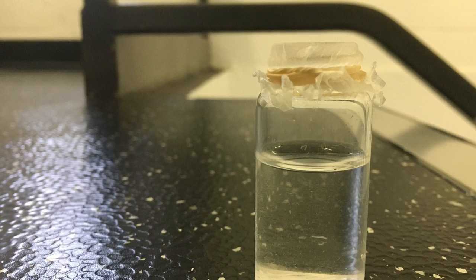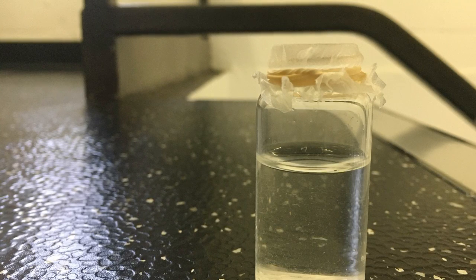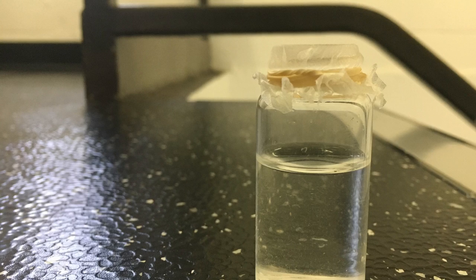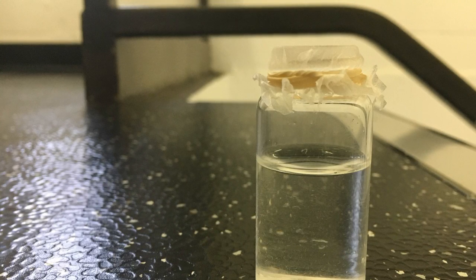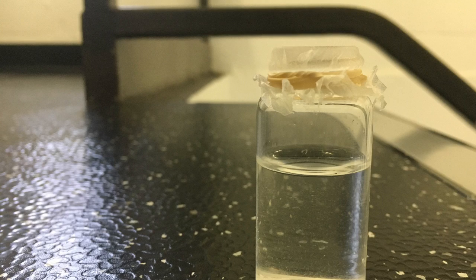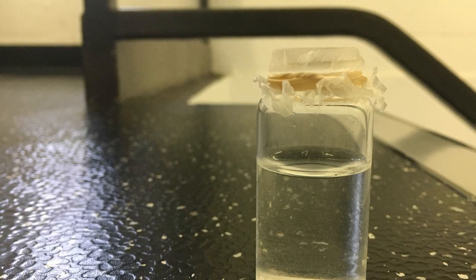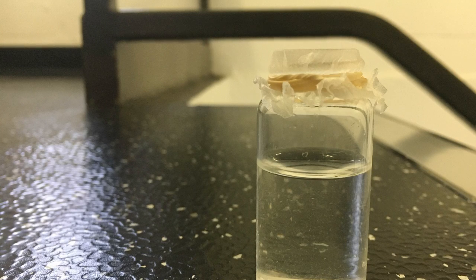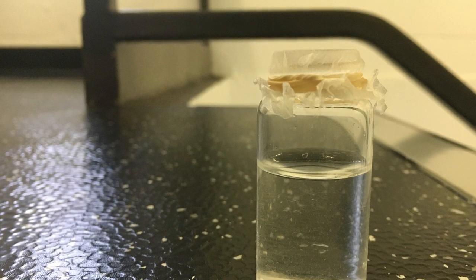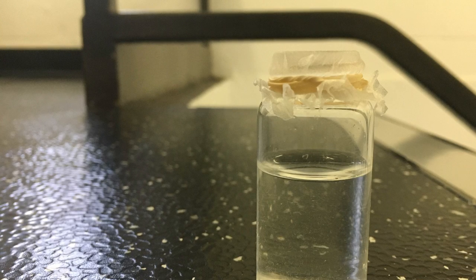solution, and then to wait for the aluminum hydroxide to precipitate out of the solution. It is important to wait until the reaction is complete in order to confirm that all of the aluminum hydroxide has precipitated out of the solution. At this point, you add the rest of your 9M H2SO4 to the solution. It is important to do this step because the additional sulfuric acid neutralizes the basic precipitate and causes it to dissolve.